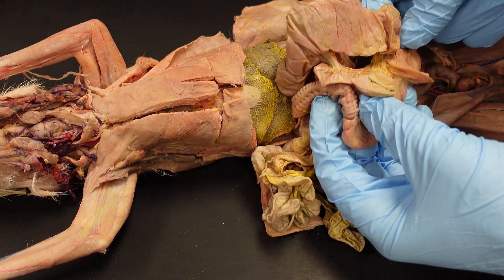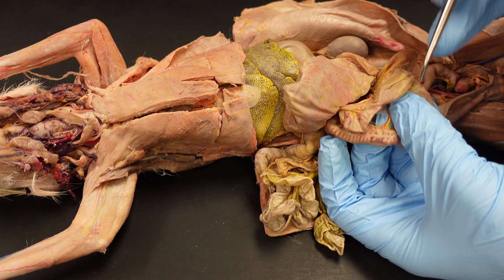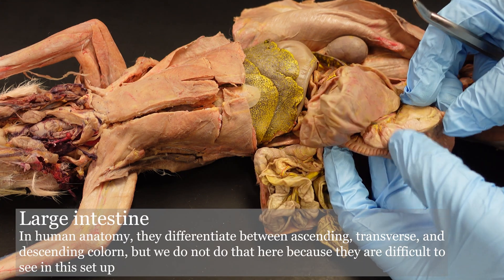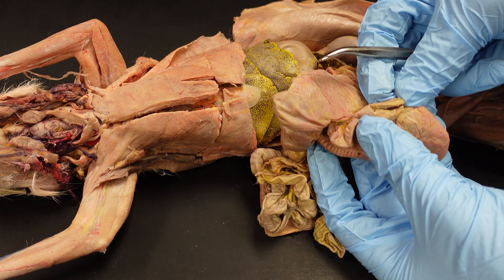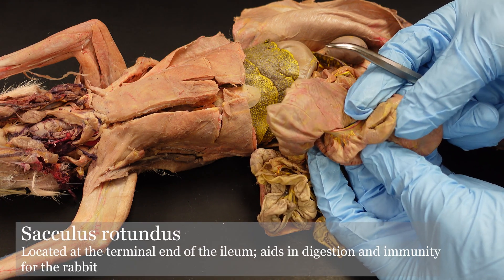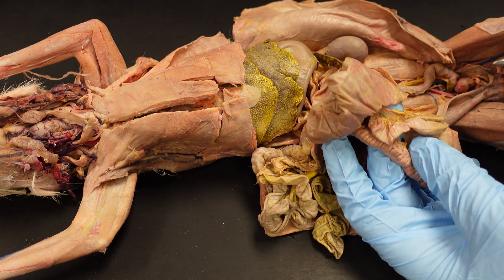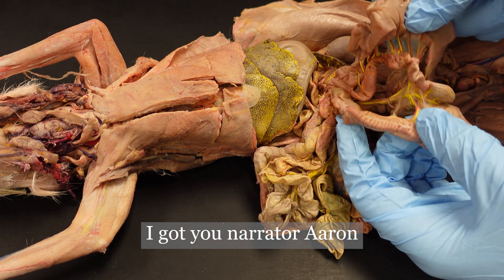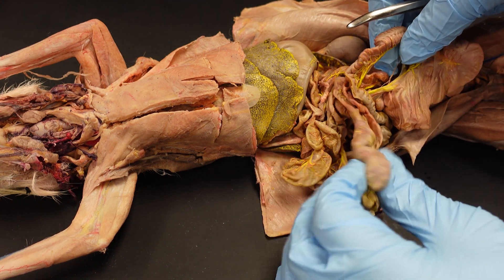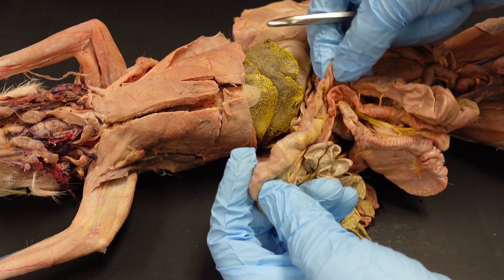The cecum joins up with the ileum of the small intestine and the large intestine right here. There's a portion there that has a name we're not going to cover, and then there's this little thing that Jackie describes as a Muppet — this is the Sacculus rotundus. I don't recall the function of the Sacculus rotundus at this time, but editor Aaron will add it in. So: Sacculus rotundus, that big baggy cecum, and the vermiform appendix at the end of that cecum.